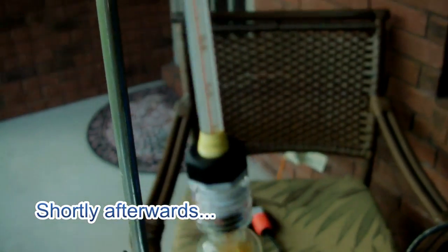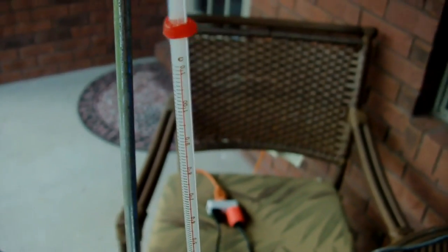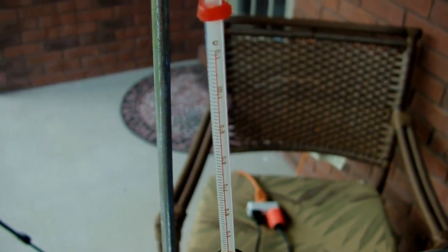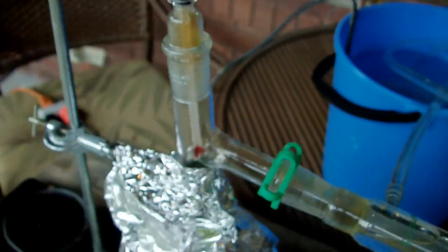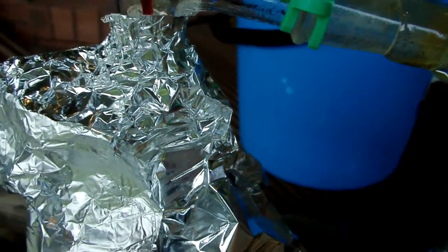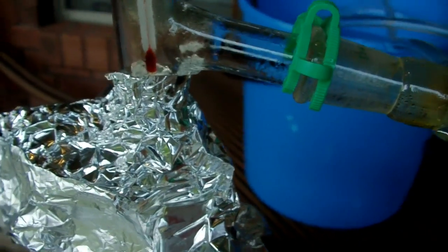So I just noticed that I way overshot the temperature for this. This should be at about 83 to be distilling nitric acid, and it's much higher than that. So that means I definitely should have approached the boiling point much slower than I did, rather than just cranking it up to maximum like I did.